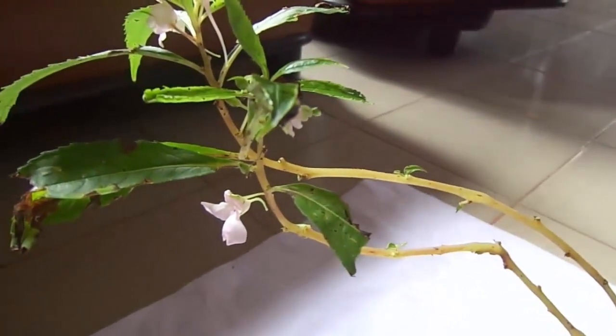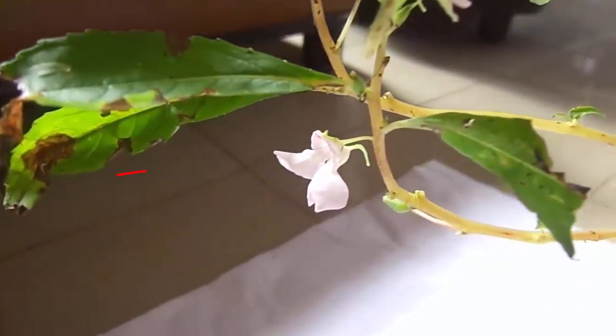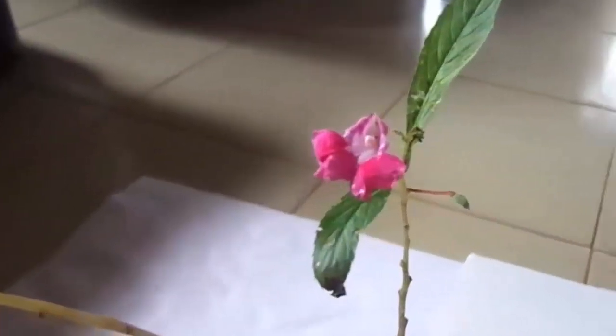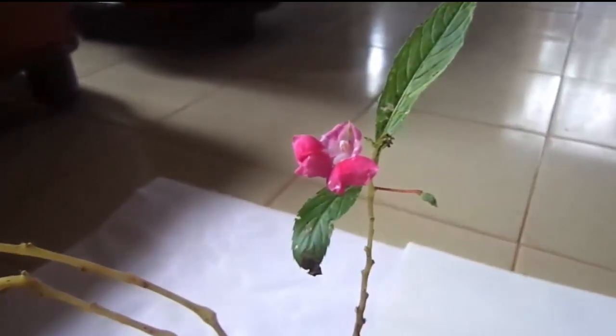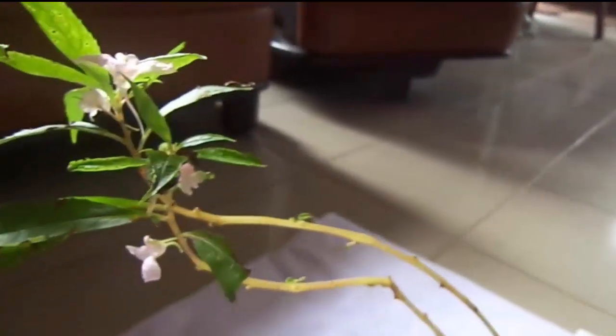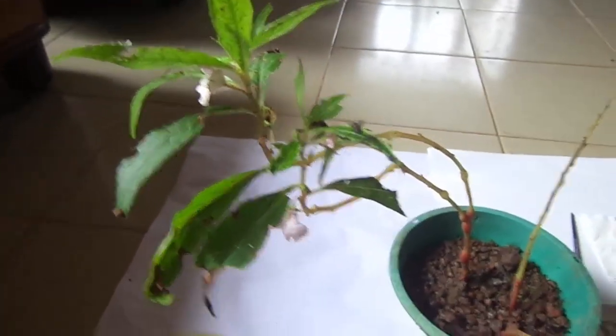Our group decided to use the kudala plant. There are two varieties of different flower colors — a white color kudala plant and a pink color kudala plant. We are going to pollinate these plants artificially and obtain the F1 generation.